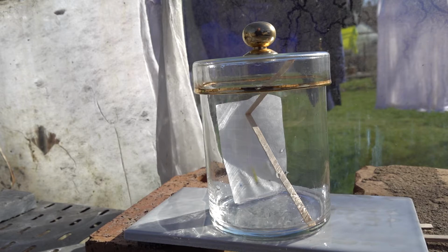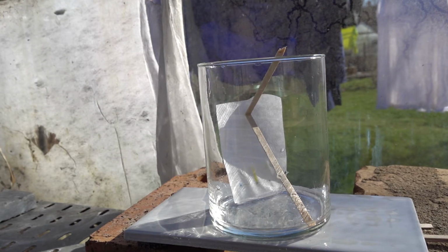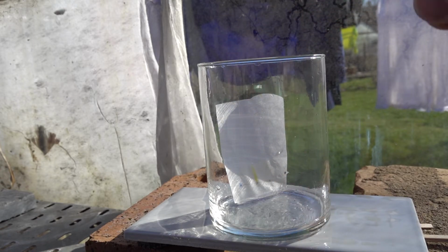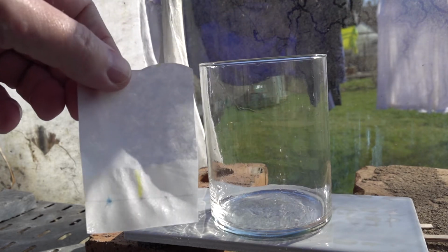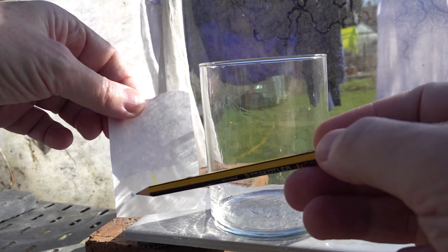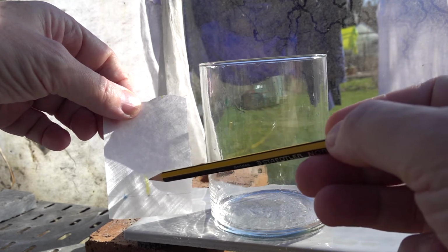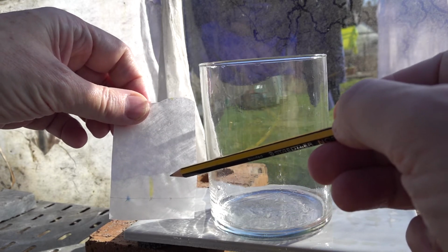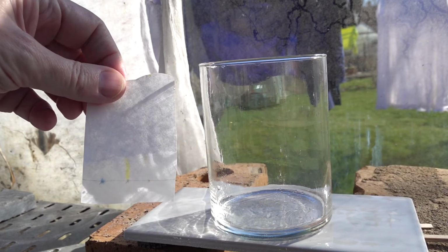Well, we could let that run, but let's take it out already because it illustrates what we in fact need to see. So we take the chromatogram out. You should be able to see that indeed the blue is more or less remaining at the baseline. The yellow in the green is streaking up, and the yellow from the curcumin is really riding high on the paper.